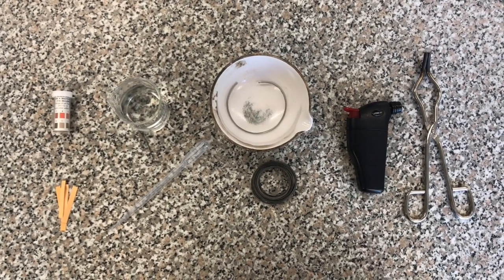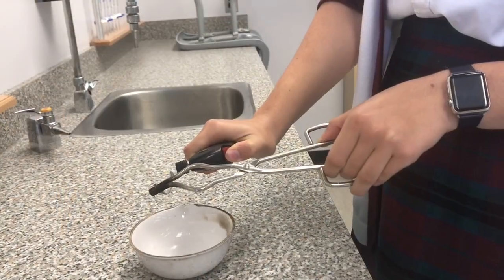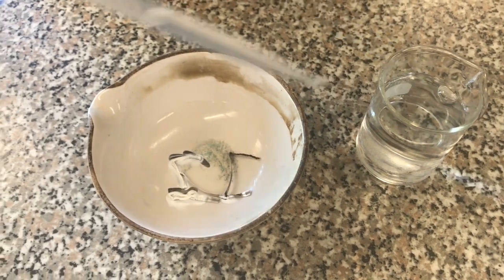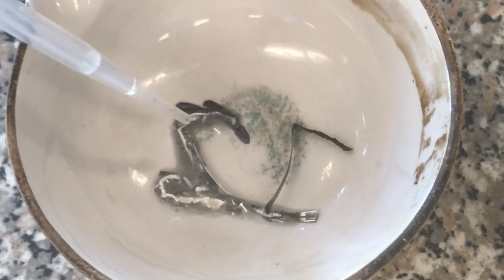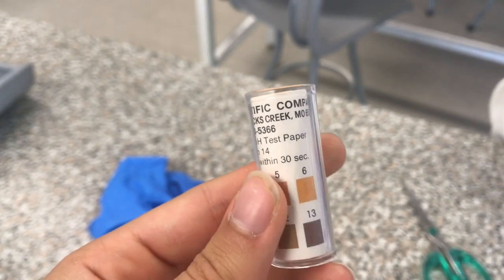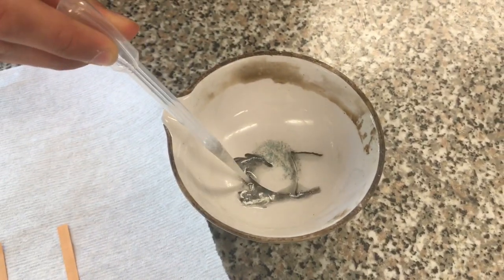The process of this experiment involves flaming magnesium to create magnesium oxide, then mixing this metal oxide with water, and finally putting this solution to the litmus paper test.